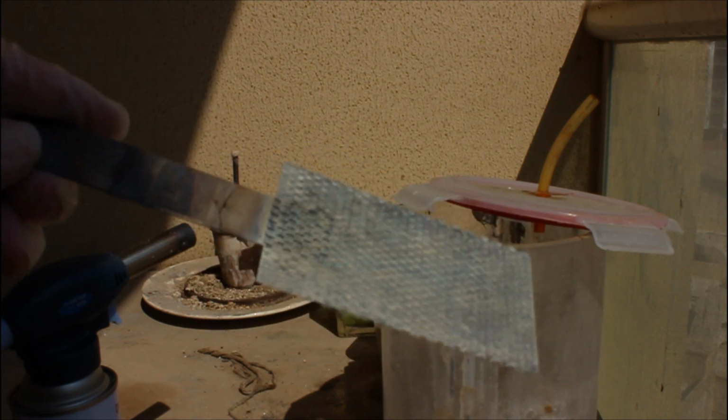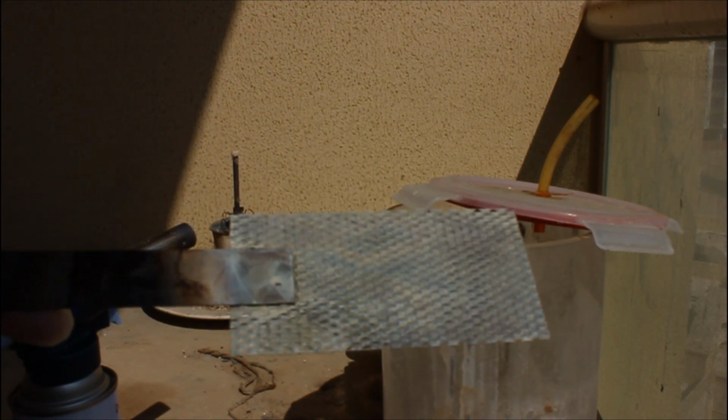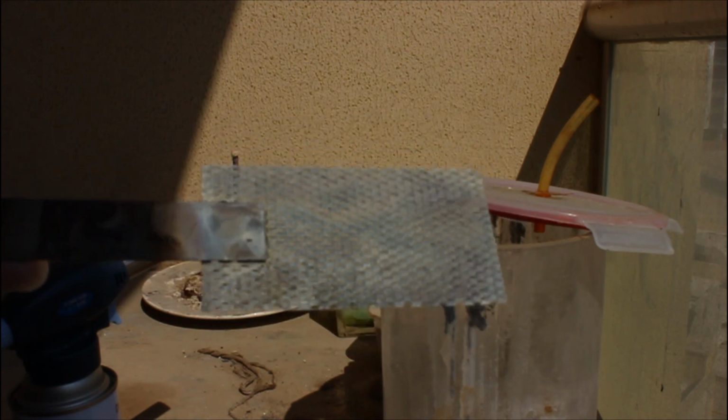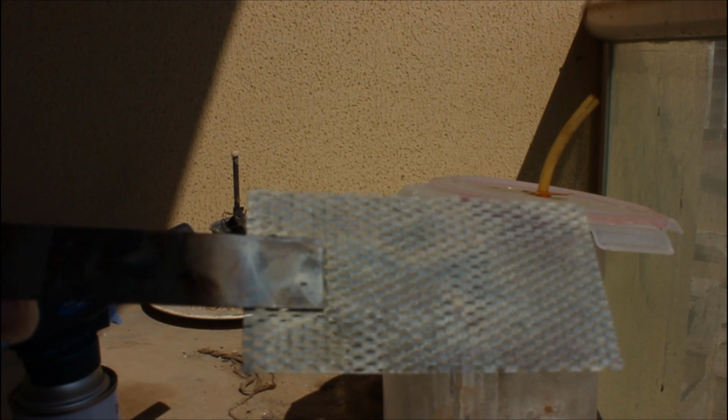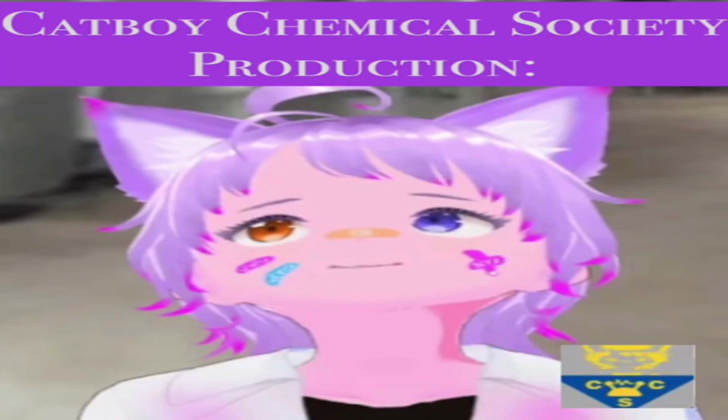It looks white, yellow, with a little bit of blues and purples, but the whites and yellows are what matter the most. You can even see I thoroughly baked the handle. Next step, plating.